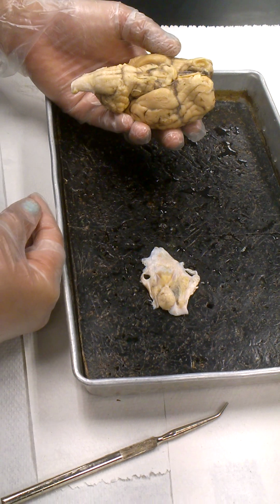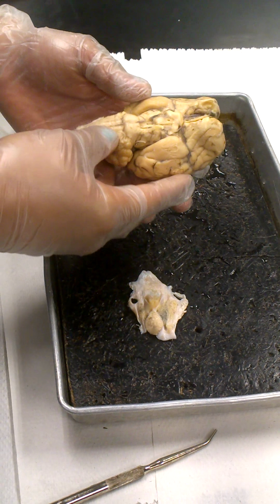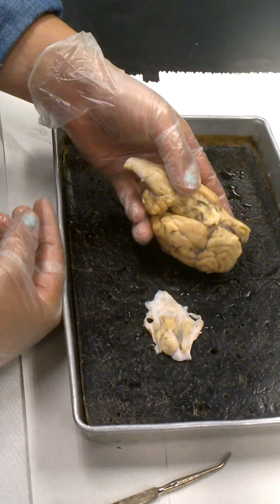Okay? So look in the region she's pointing at. Don't expect to see something as long as she's pointing out. Just in the region she's looking, try to find those short little stubs, that's the nerve that we're talking about.